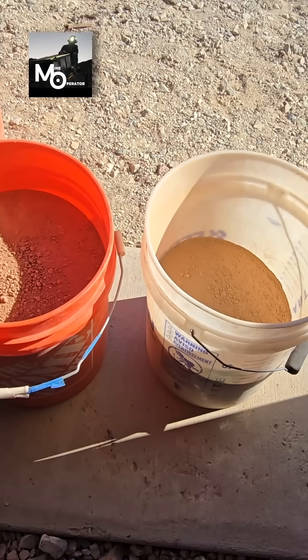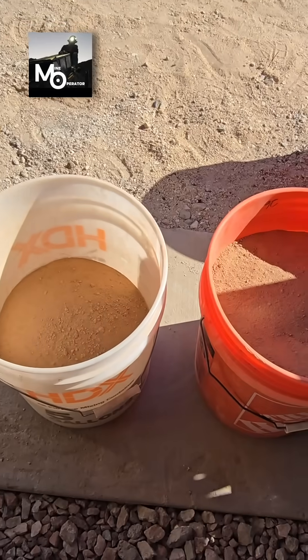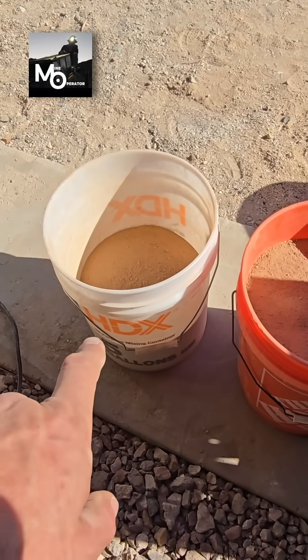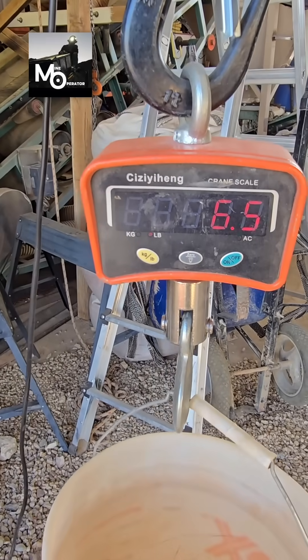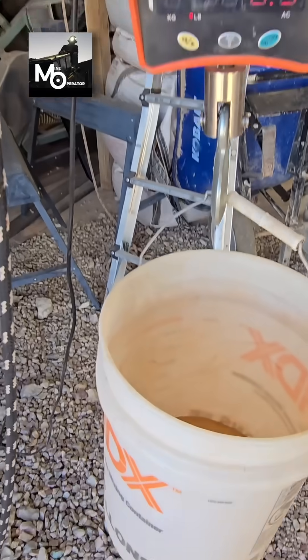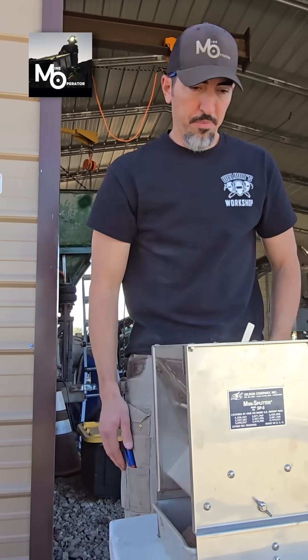Okay, we're at the 50/50 split now. Here's half, there's half — split into equal amounts. This one I'm going to split down further. That's 6.5 pounds; the bucket weighs two pounds, so we're sitting at about four and a half pounds. That is good enough for me — I'll hand that off to Chad.